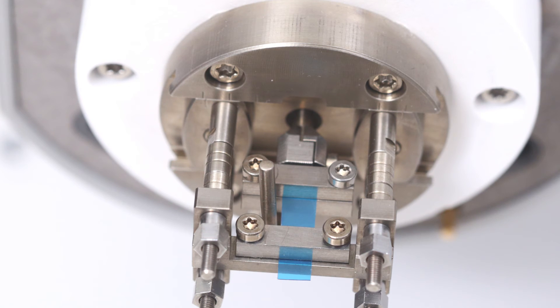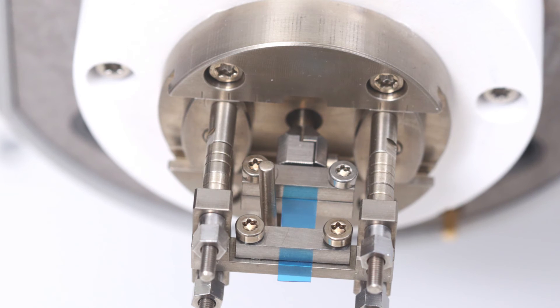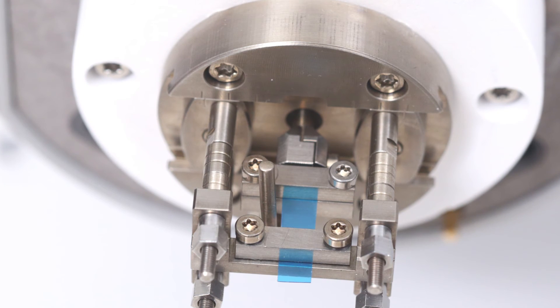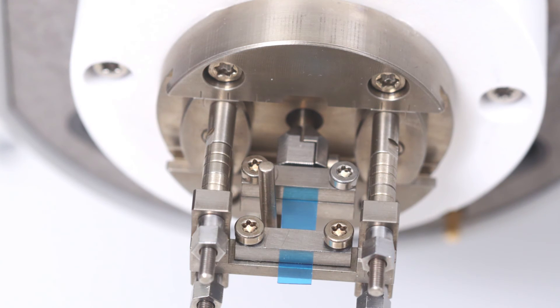With thin films or fibers, reclamping at lower temperatures is not common practice. With thicker samples run in tension, reclamping may be necessary at lower temperatures as a result of shrinkage.